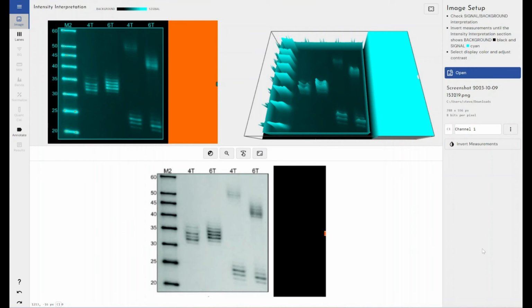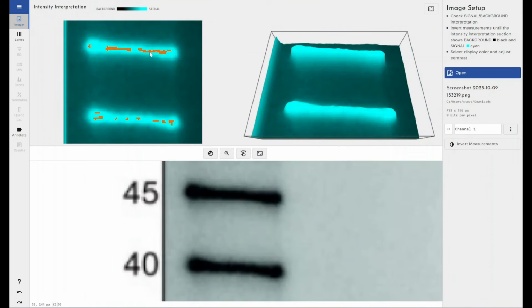Now, the first thing I'm going to bring your attention to is the fact that there are some areas of this image that are saturated, and these are shown up in bright orange by default within Phoretix 1D. We've obviously got this large area here, which is part of the cropping that I've performed to get this image off the internet, and you can see within my bands for my marker lane, we've got some areas of orange as well, and I'll just zoom in on those. So these areas highlighted in orange are areas where the pixel intensity value has hit the highest value it could, essentially saying that it's gone beyond the limit of detection of the device that you've used to capture the image. Now, this is fine if it's part of your marker lane.